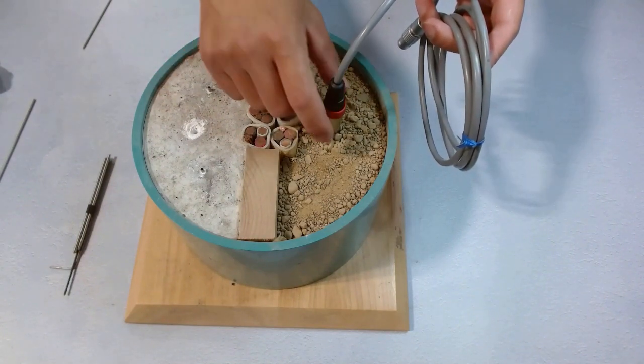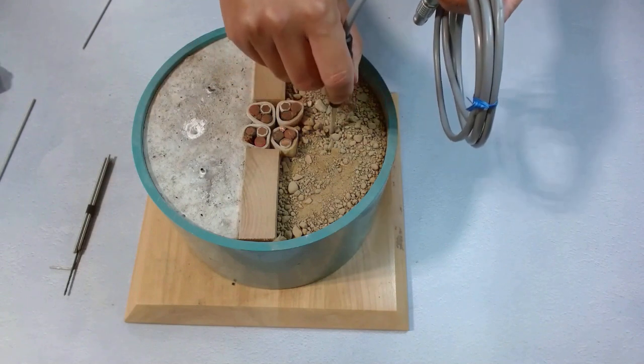After the test, we can pull it out easily and clean it.